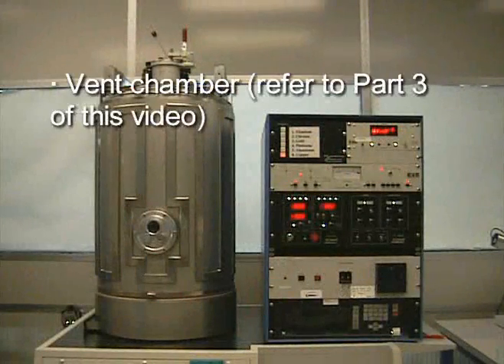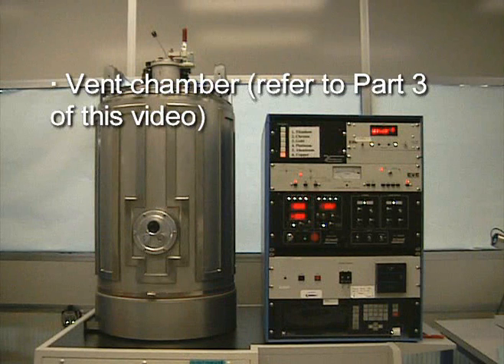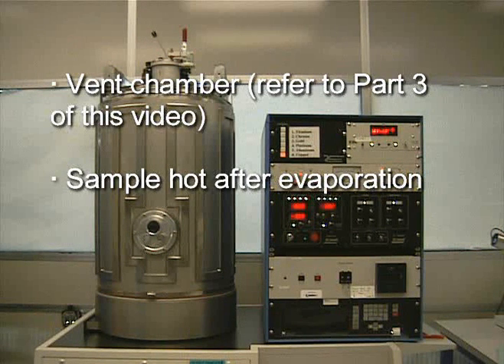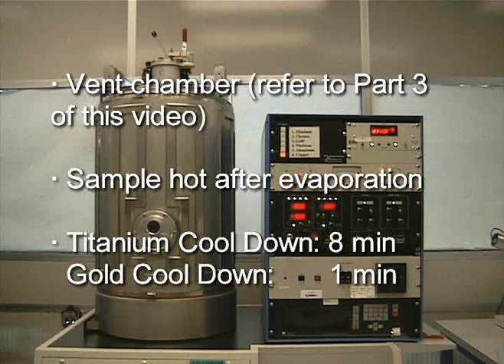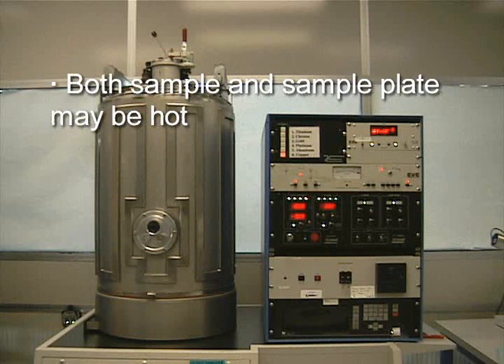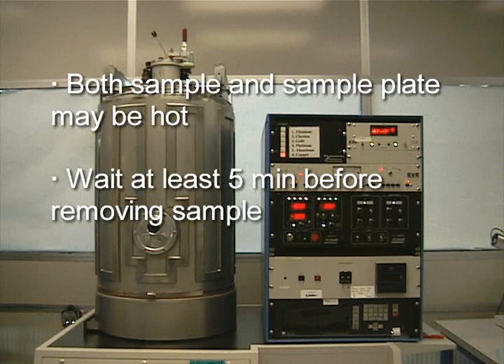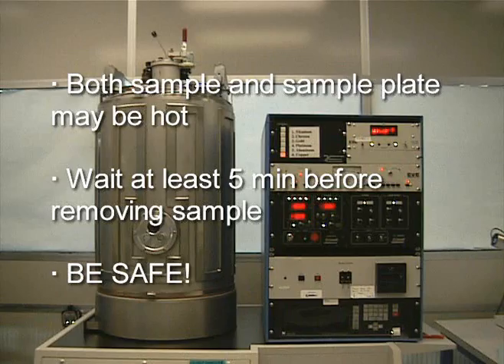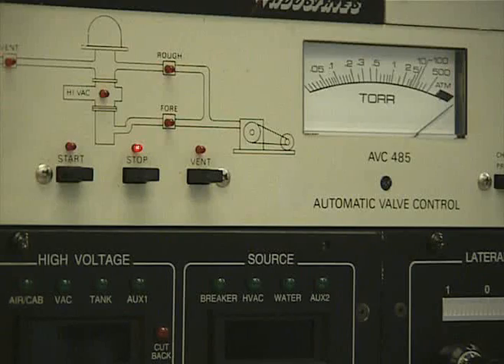After doing so, we need to vent the chamber. This is done in the same way as in the beginning of this video. After the evaporation, the sample will be hot. Give some time for the metal to cool down before taking it out. Different metals cool down at different rates. Titanium takes the longest at 8 minutes, and gold takes the shortest at just under a minute. Also remember that both the sample and the sample plate may be hot. As a general rule, wait at least 5 minutes for all metals to cool down or until the metal has stopped glowing. Please remember to be safe. After removing your sample and lowering the cage, we need to pump down the system. We pump down the system by pressing the stop button and then the start button.